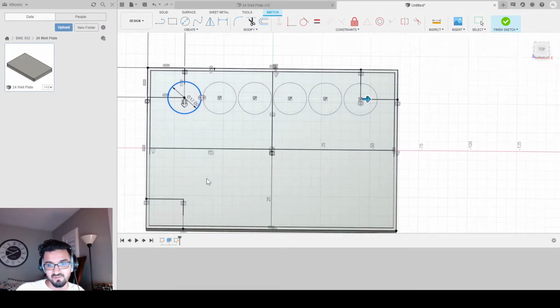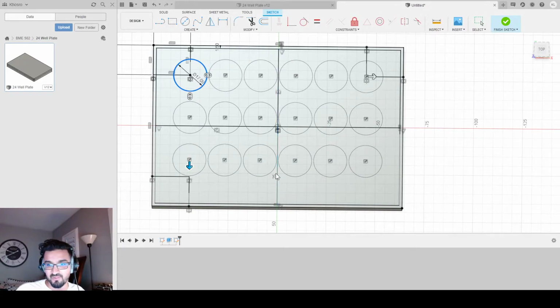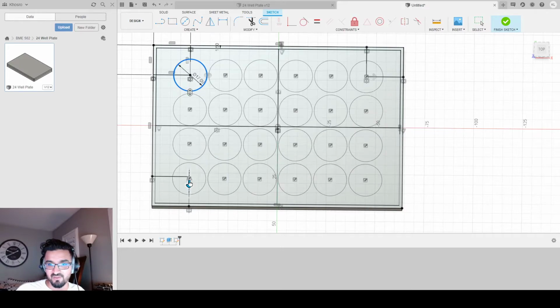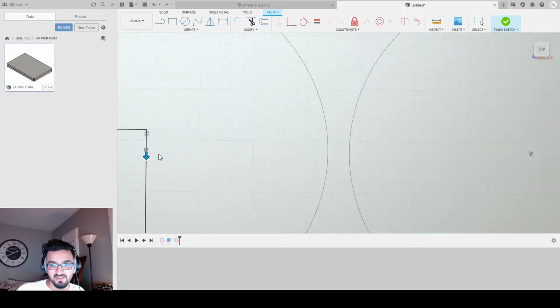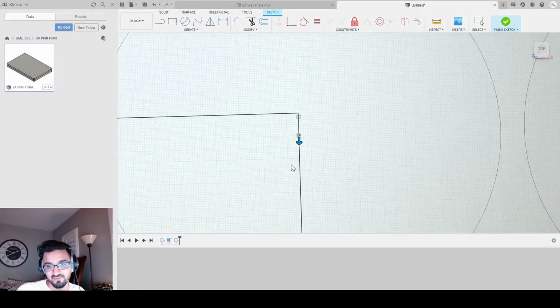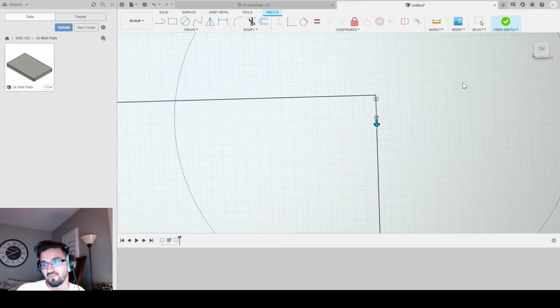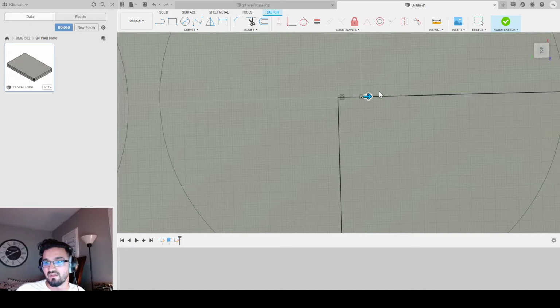Next, I am going to hold down and have 4 replicates of my wells going down. Notice how my check mark doesn't snap to this grid? That is because they don't snap. You gotta kind of eyeball it or do it yourself, right? So let's rotate this. I'm gonna rotate it by grabbing the cube here, so it's easier for you guys to see what I'm doing. And I'm gonna grab this arrow, and I'm gonna make sure the checker mark is right at the intersection of these two.